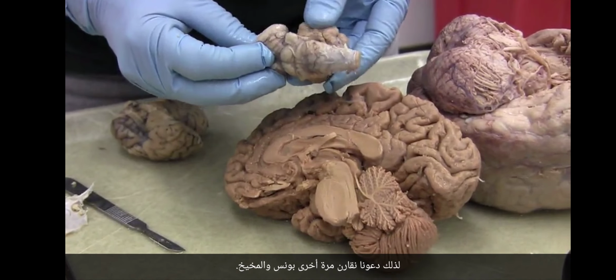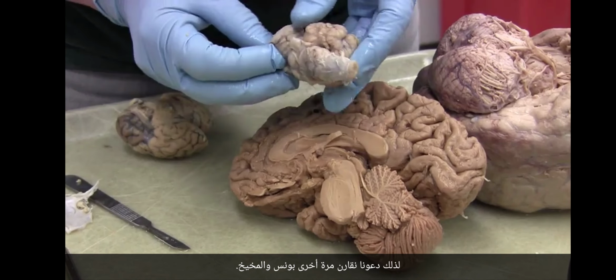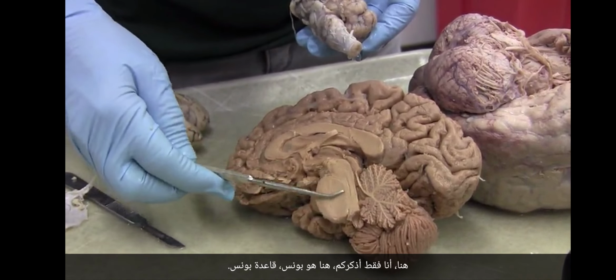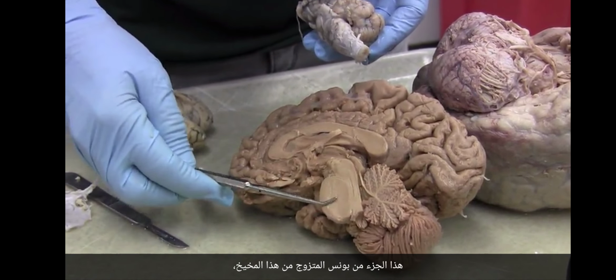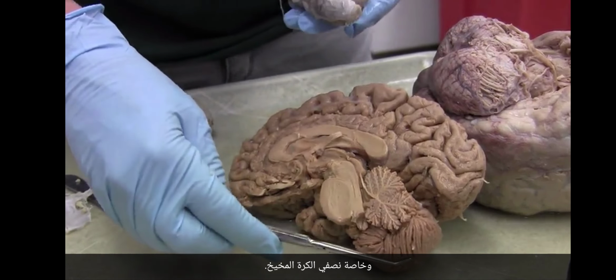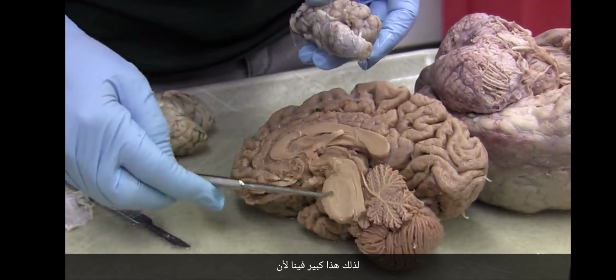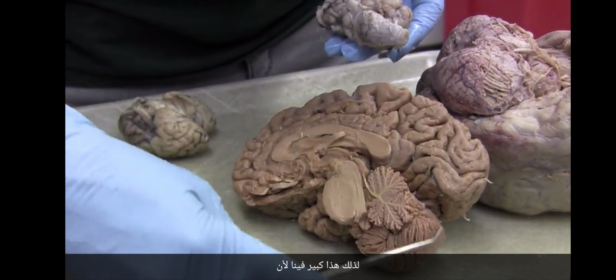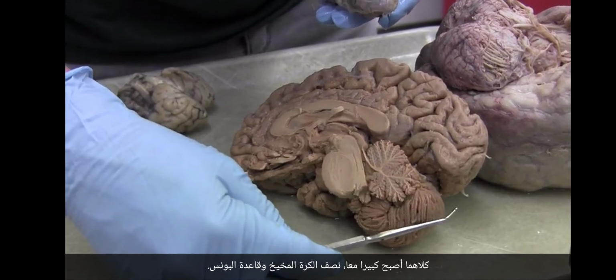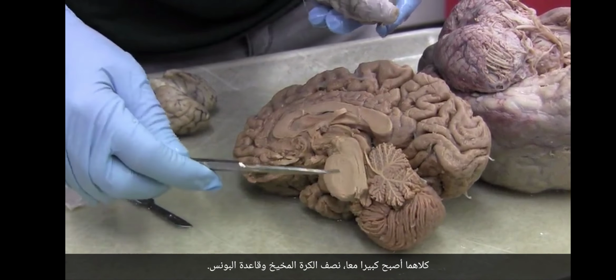So let's compare once again the pons and the cerebellum. Here, I'm just reminding you, here is the pons, the base of the pons. This is the part of the pons that is married to the cerebellum, in particular to the cerebellar hemispheres. So this is big in us because they both got big together, the cerebellar hemisphere and the base of the pons.